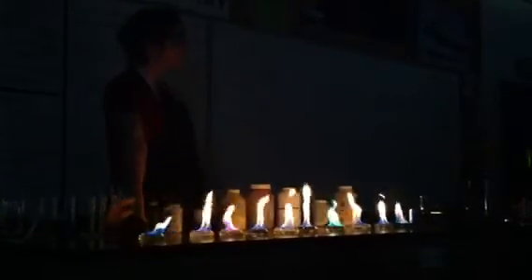This is the sodium. Some sort of pink orange over here. Some more orange here. What gives you the green? Copper. I like the red one the best. I like the red and green one. Remember, this is our control — this is what you compare the colors to. This is the color that the alcohol flame has. Look at the one next to it — you see flicks of orange. Anything that's different comes from the salt. Look at the mix between the red and the green. That's so cool.